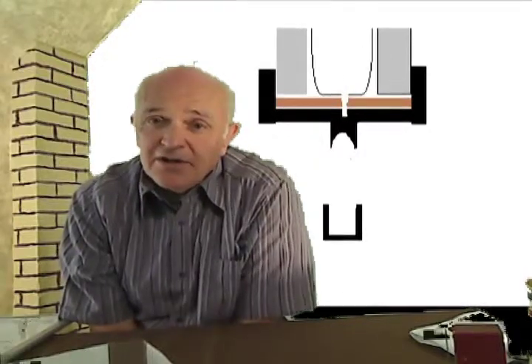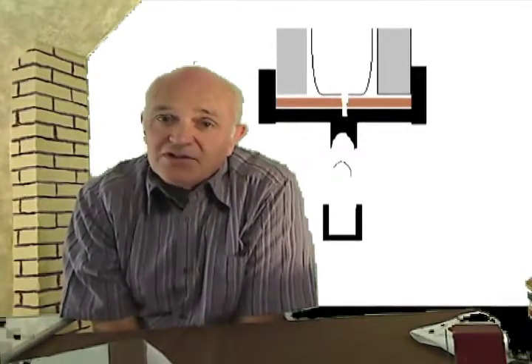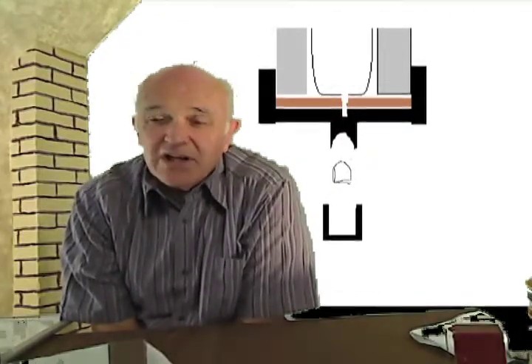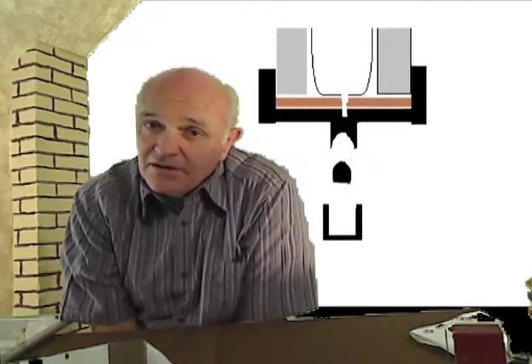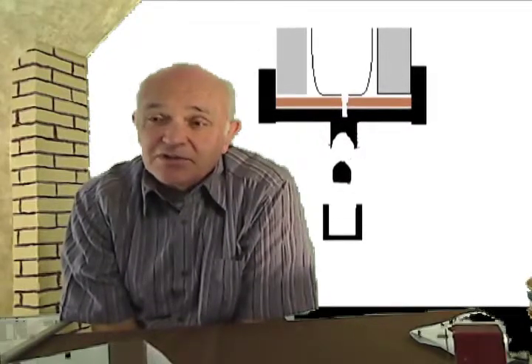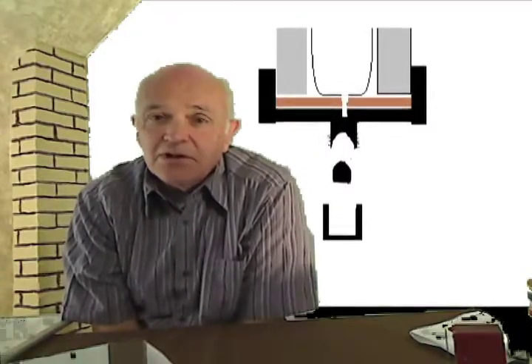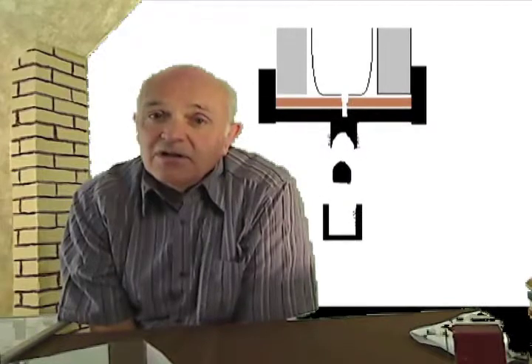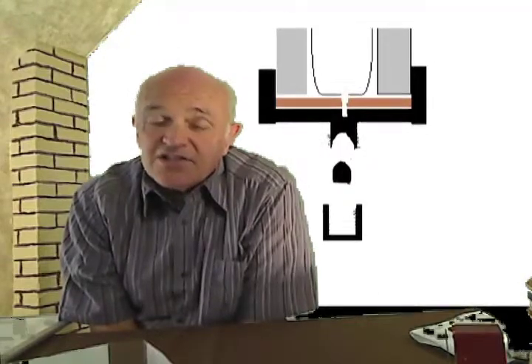Take the column cutter and cut off a little bit more of the end. The argument is that the graphite ferrule is a reactive substance and the graphite pieces will stick to the cut glass and cause problems, so you want to cut off the end so you have a fresh cut. The way to do this is to gently scratch the column with the column cutter and then gently break it off. The column cutter is like a little piece of quartz, a material that's harder than glass. I've seen them made out of carbide steel, but it's usually just a little quartz crystal. You look around your lab and you can find one. Then put the same amount of column coming out of the ferrule that you saw, stick it back up where it belongs, take the nut, twist it back on, and snug it down with a little wrench.